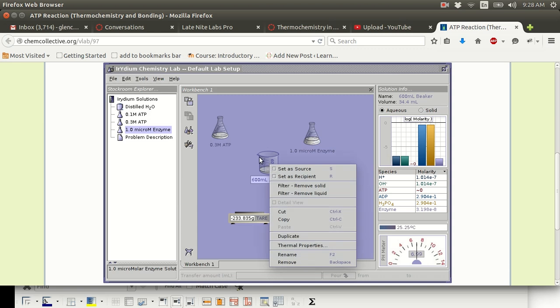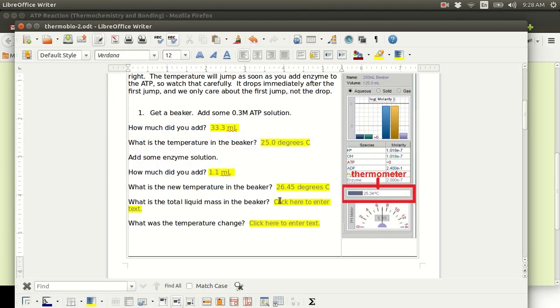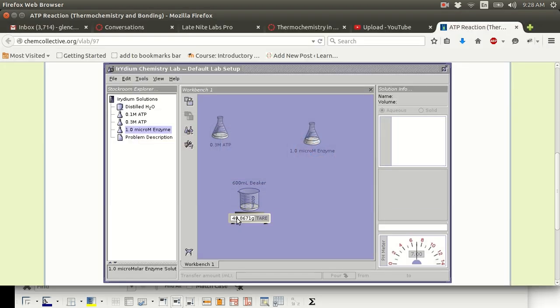But I will show you that way after I weigh the beaker. So now I'm going to put this full beaker on the balance, and I get 40.8671 grams. So total liquid mass is 40.8671 grams. Now you notice that I put the beaker on there and it says 40.8671. It doesn't say 200 something. That's because I tared the scale with the empty beaker on the scale, meaning the scale thinks that the empty beaker weighs 0. So whatever is in the beaker is what's getting measured.